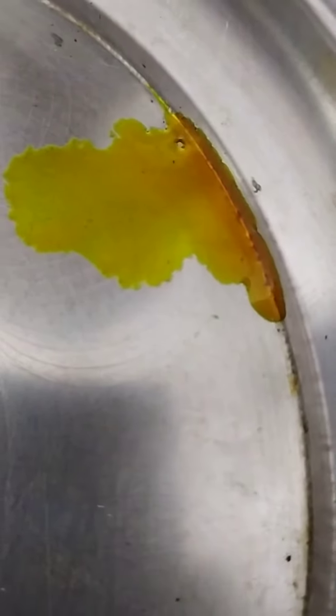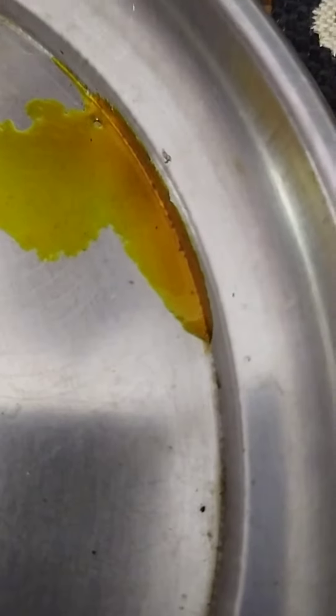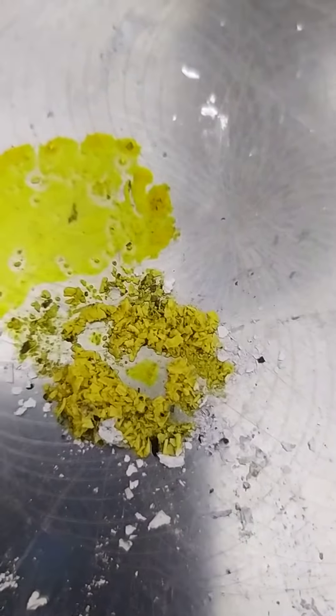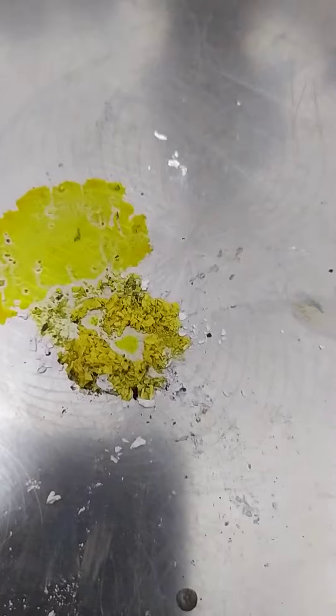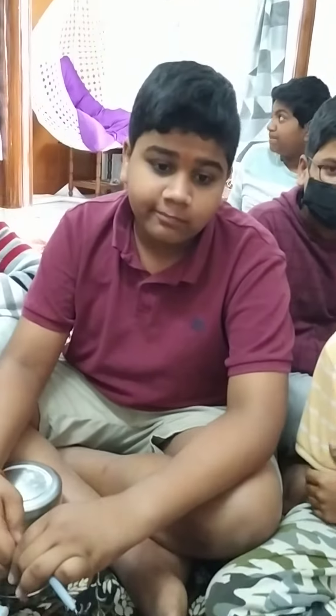Generally, if you pour one drop here, you see it is orange color. Can you see clearly? Yes. Because normally methyl orange is orange color, but when you mix it with magnesium oxide, it turns yellow. Yellow color indicates magnesium oxide is basic in nature. So all metal oxides are generally basic in nature. Fantastic. Bye-bye.